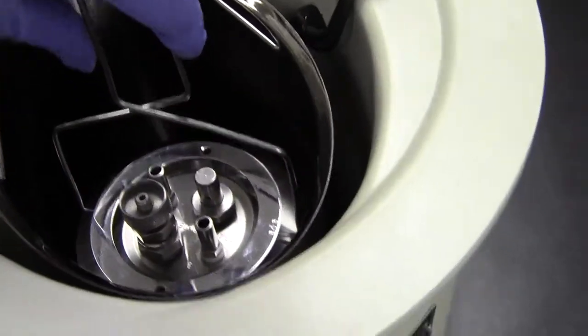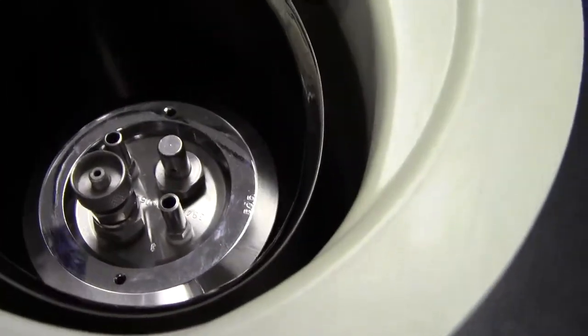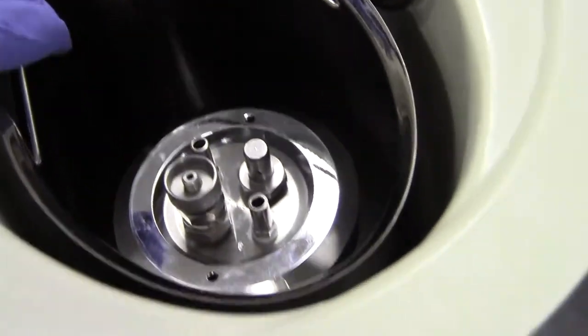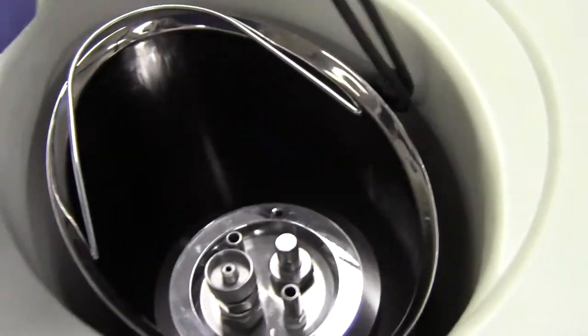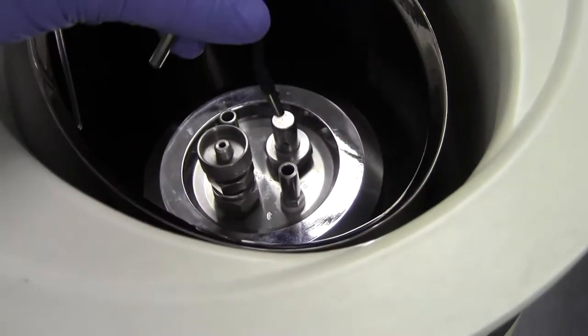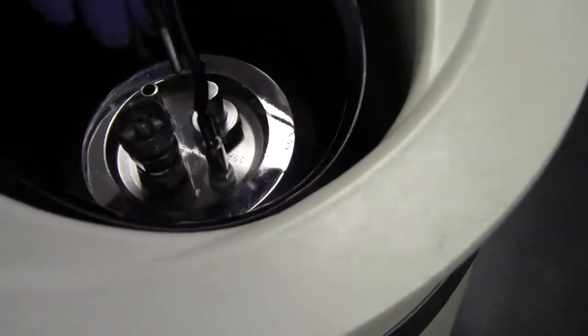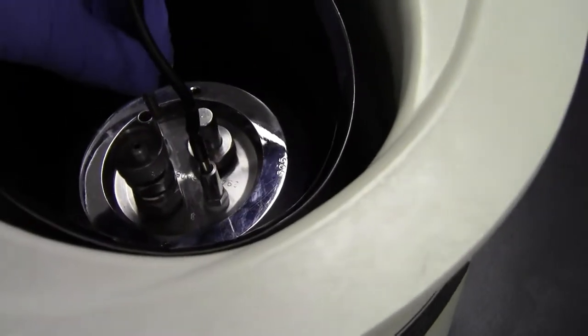Do it very carefully, maybe a little more careful than I did. Before you actually descend it into the two liters of water that would be in here, you would have inserted the fuse wires, the connectors, and they go like so, and like so.